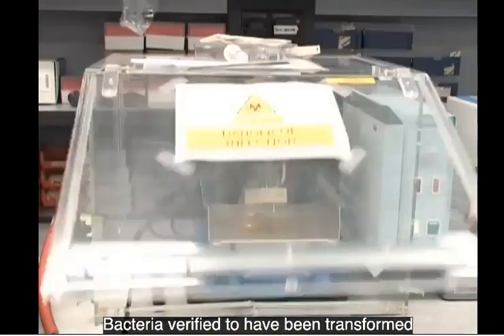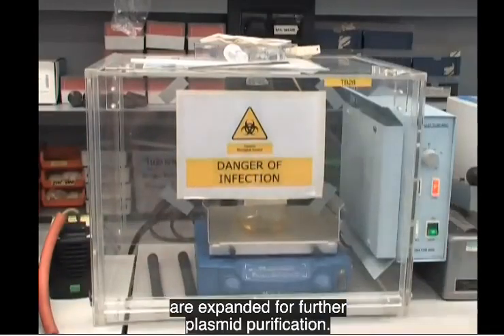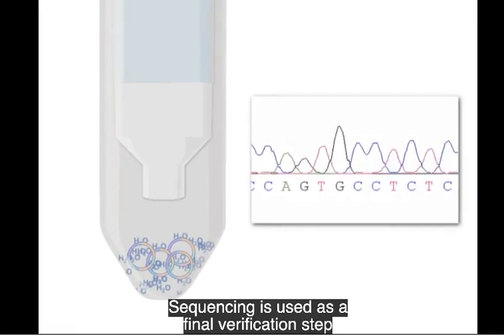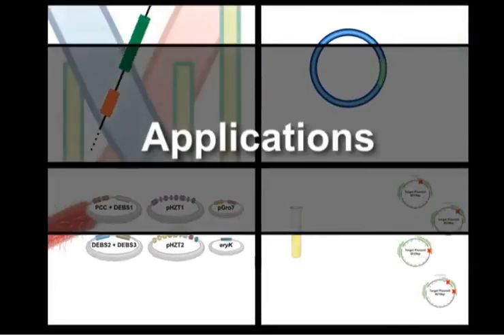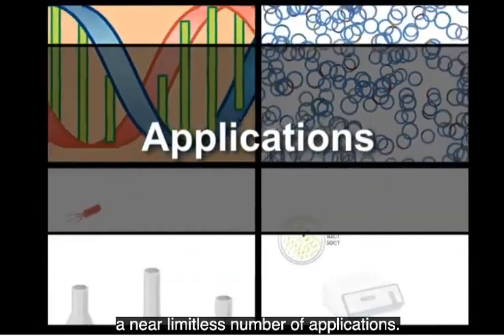Bacteria verified to have been transformed with an insert containing plasmid are expanded for further plasmid purification. Sequencing is used as a final verification step to confirm that your gene of interest has been cloned. Molecular cloning can be used for a near limitless number of applications.